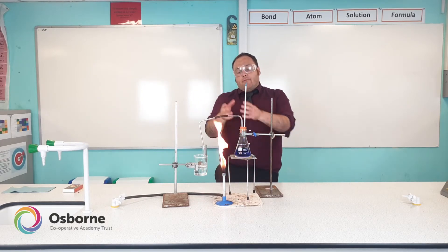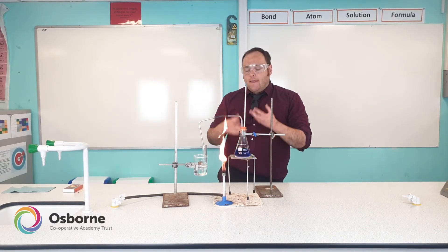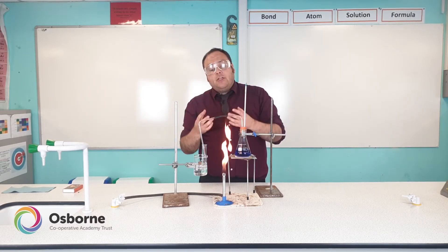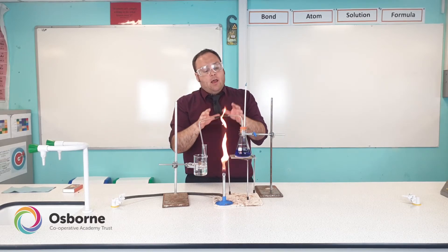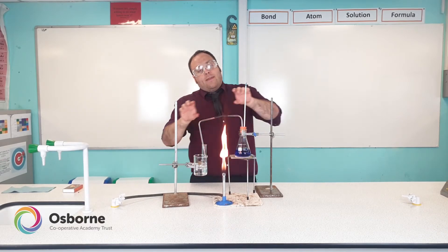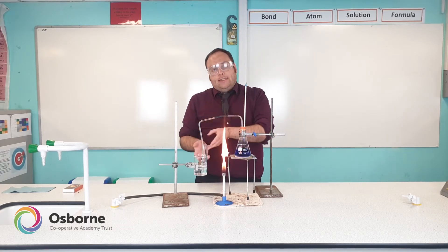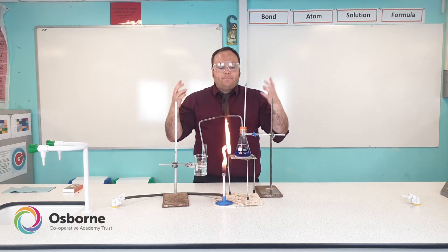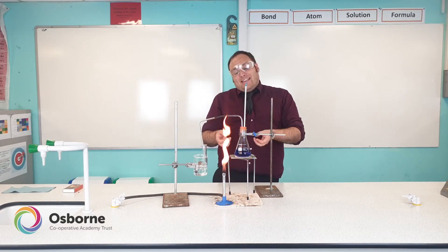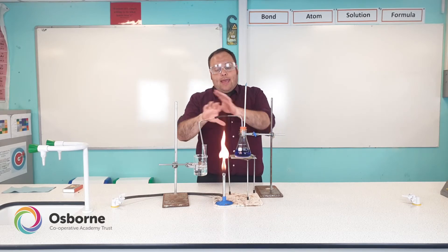Comparing this still to the round bottom flask setup, we won't have as even heat distribution, but that won't affect the separation. The big thing that will affect the separation is that we don't have a condenser between where we're heating the mixture and where we're collecting the water. Without that piece of equipment we expect to lose quite a lot of the water to the surrounding atmosphere. If we were to evaluate this apparatus, one key improvement would be to include a condenser in this part of the still.